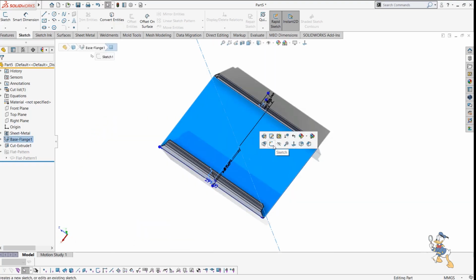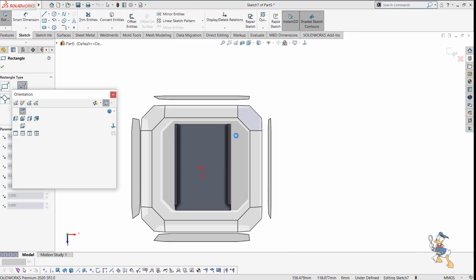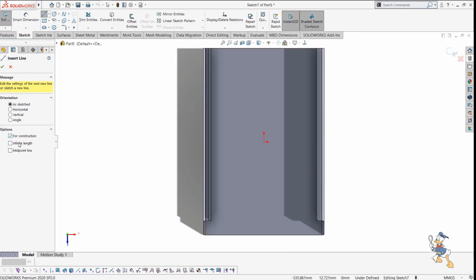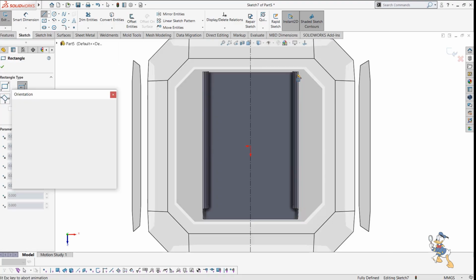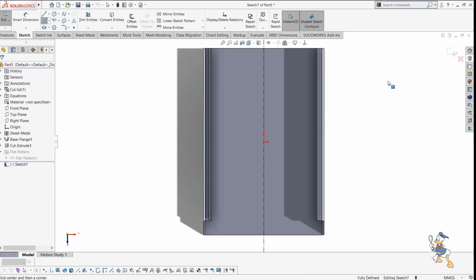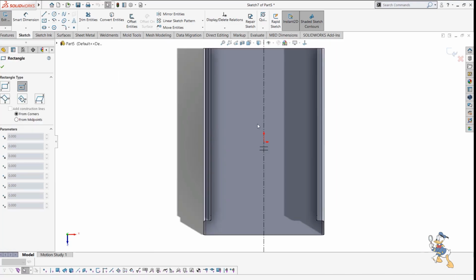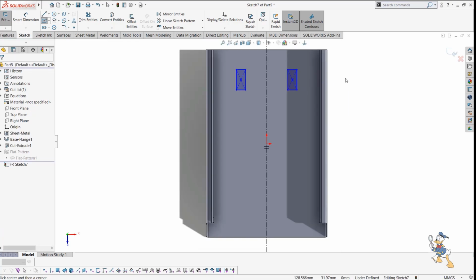Suppose we need to design some cuts. We can design cuts as well. So we need to start with the line again. Yes, we have designed a line. Then we need to design a rectangle. So we can design a rectangle. Rectangle is just like this. And now we just need to define the dimension of this.